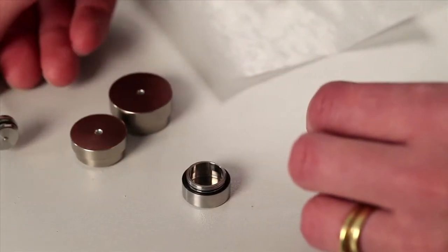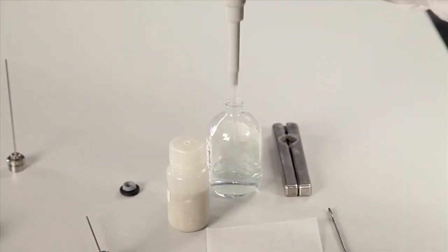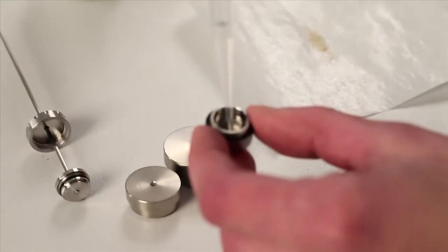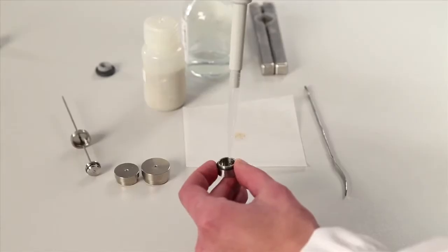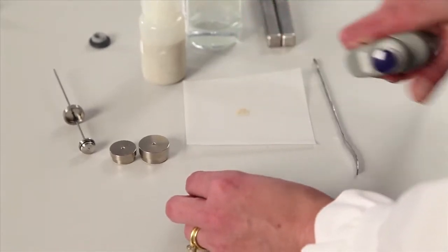The first thing that we'll do is load the outer compartment with a liquid. This is pipetted into the bottom, making sure that we don't have any bubbles or any drops that are on the side of the ampule.